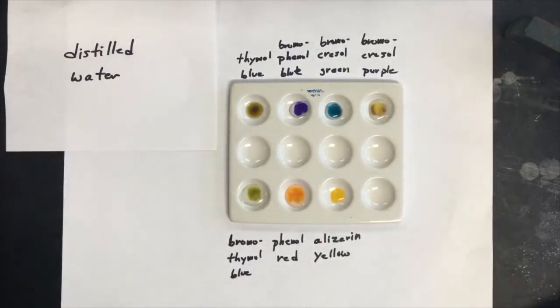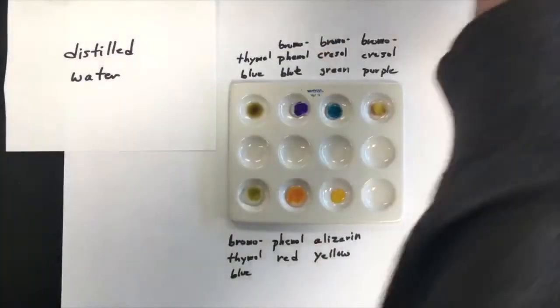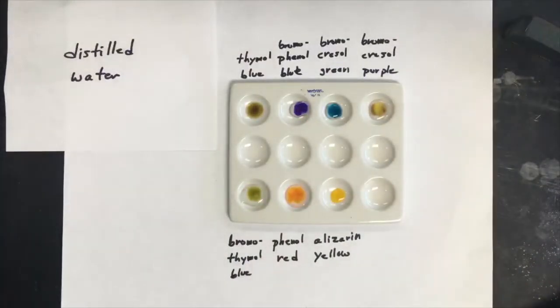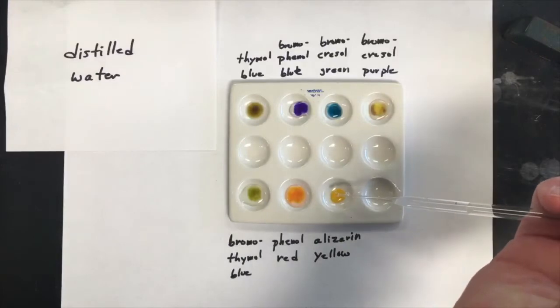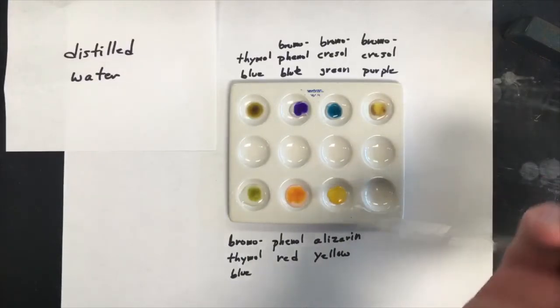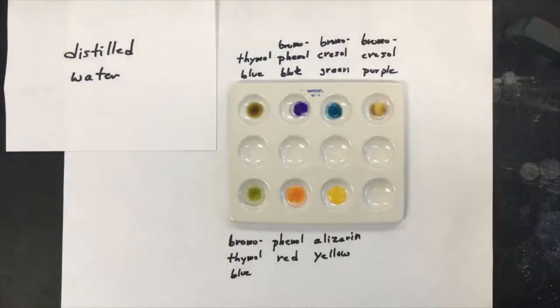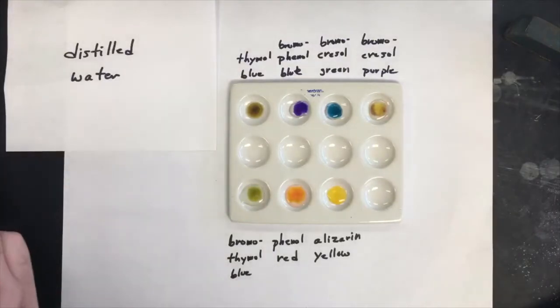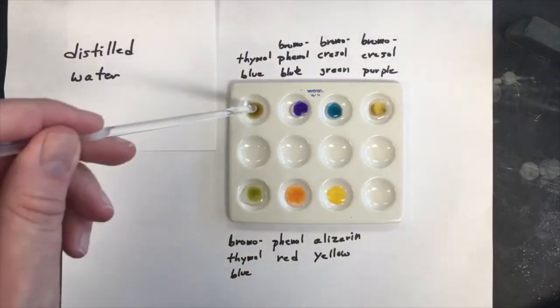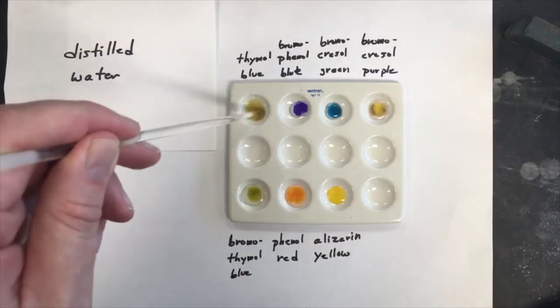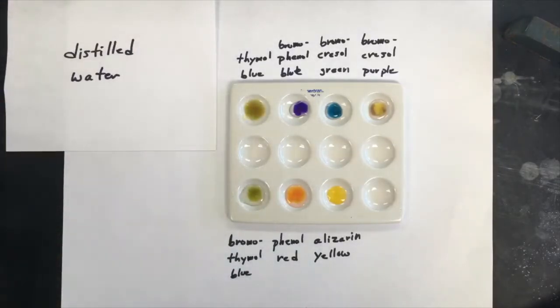Well, maybe I forgot the water there. There's a little water in it. And I'm going to take a stir rod and mix each of them. I'm going to rinse the stir rod in between.